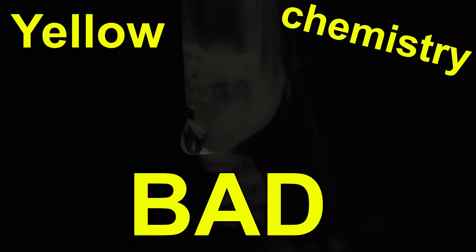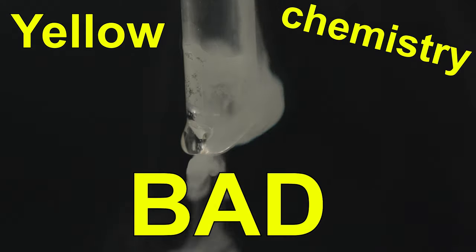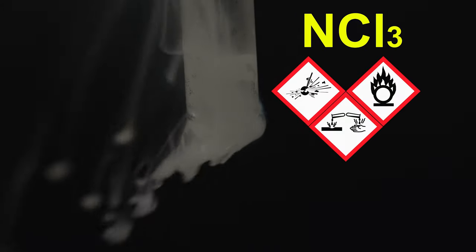I think many of you know that we should not be bubbling chlorine in ammonia solution for long, because it can form a strong concentration of volatile nitrogen trichloride.